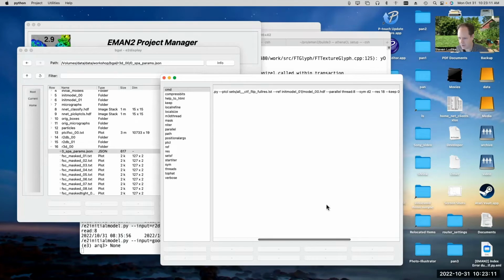We can look at the command line there, and you can see this command line. Again, it was using the full resolution particles. We were using the same initial model that we used in the other program, 8 threads, symmetry. This isn't a target resolution here. In this program, the resolution is the starting resolution. So we're telling it to start by low pass filtering, or phase randomizing, at 18 angstroms. Keep says that you want to throw away 10% of the data, and then we're going to run for 8 iterations. This program typically requires more iterations to converge.